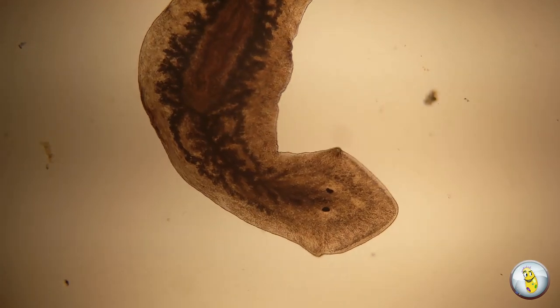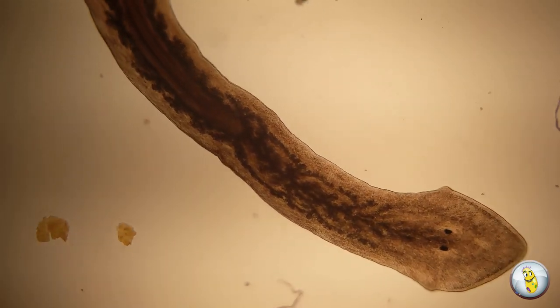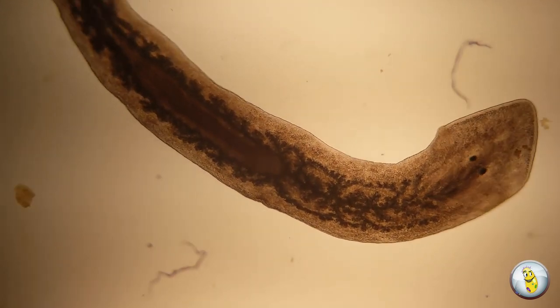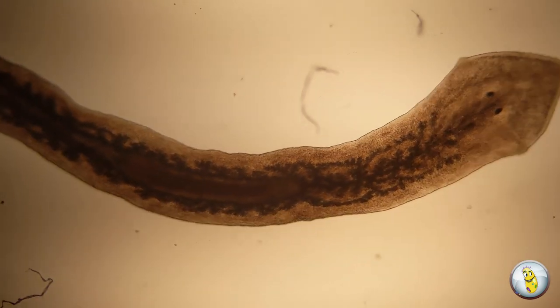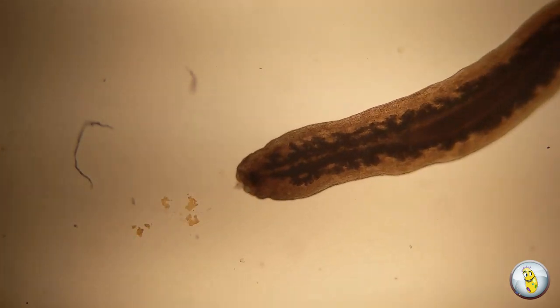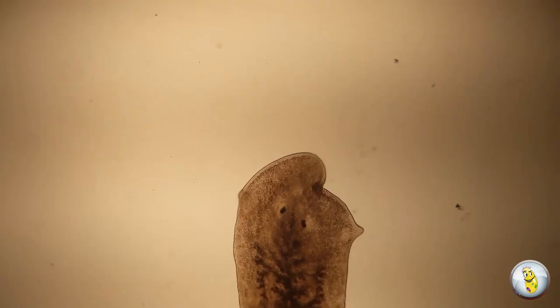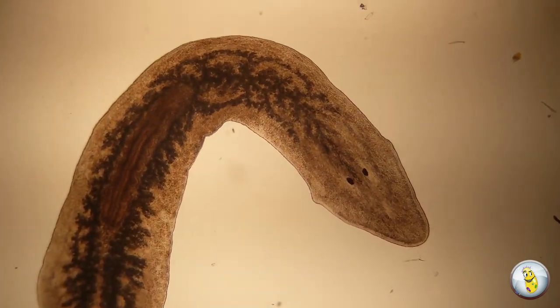You see, I've read a lot that planaria are masters of regeneration. If you cut a planarian in two, you grow two full identical planaria. I've even read that if you cut off one 279th of a planarian, you'll grow yourself another identical planarian. So you know we've got to see this for ourselves, right?